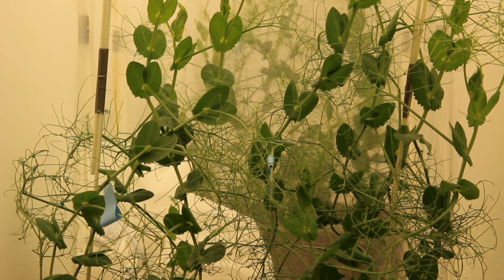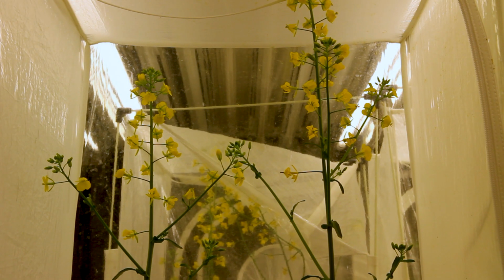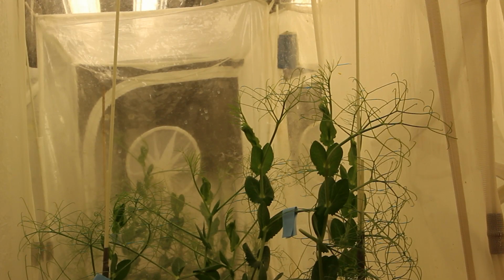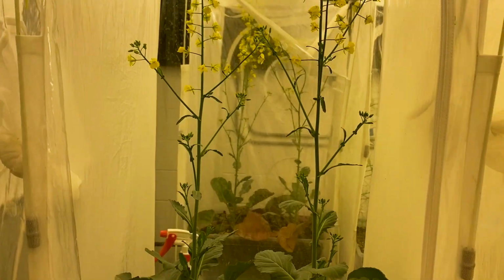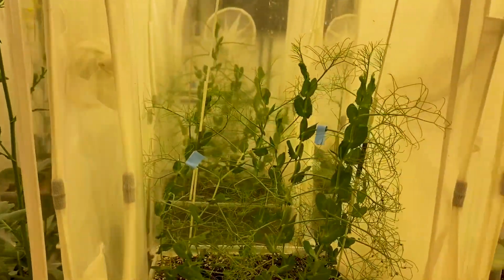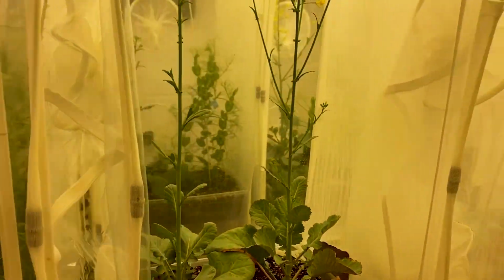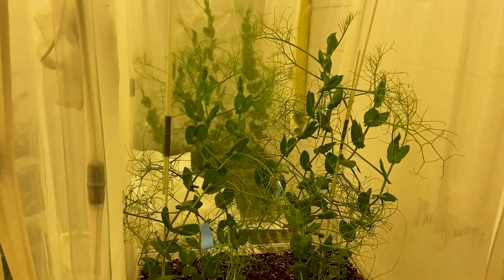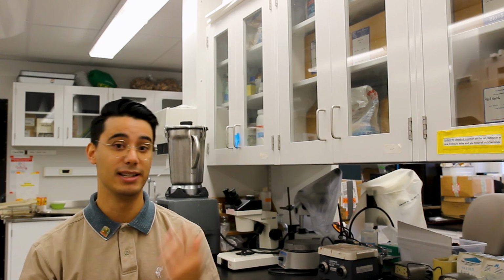So once the larvae have done all their feeding and have pupated, we remove all the leaves from the plants and scan them. So we're able to quantify how much damage they're actually doing to these plants. In addition, it's also important that we look at plant characteristics. So at the beginning of each experiment, at the end of each experiment, and throughout, we're keeping constant tabs on what growth stage the plants are in, and the height of those plants, and how many leaves are in each of these plants, because that's also important information from an intercropping perspective. How well are these plants doing when they're grown with peas? So it's important that we get all aspects, the plant side of things and the insect side of things as well.